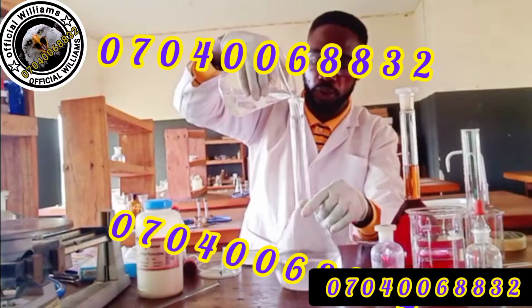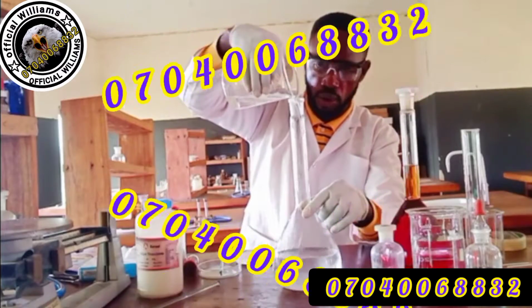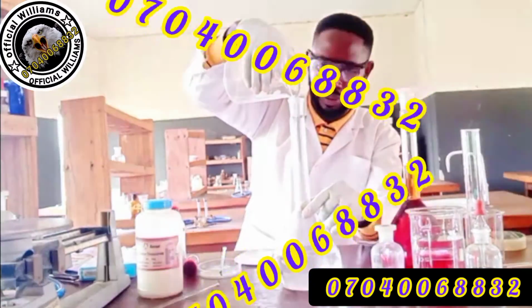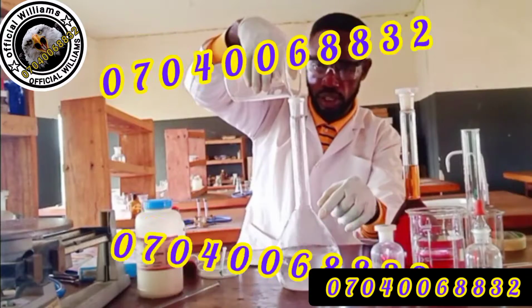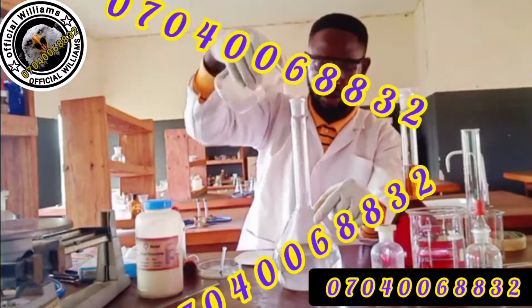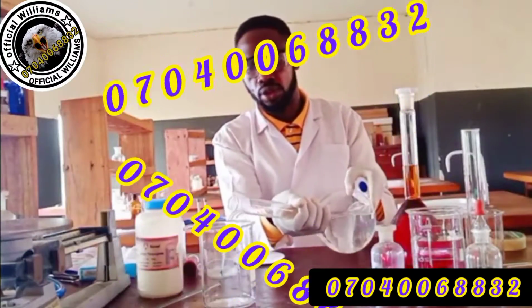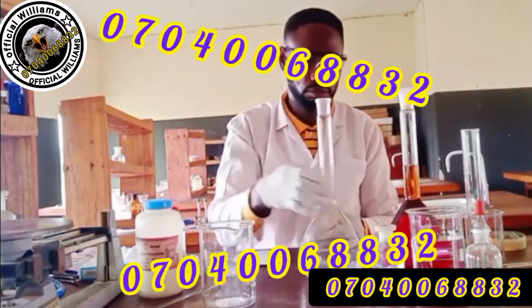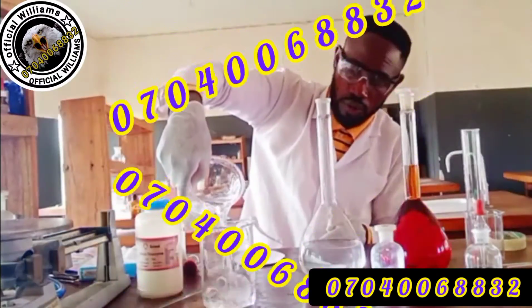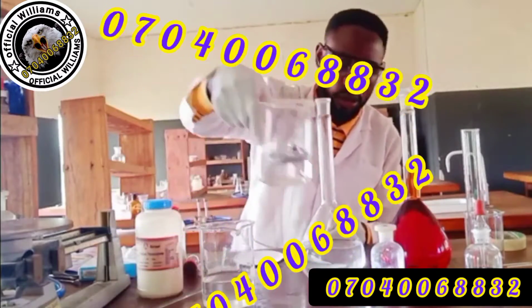Don't even allow a drop to fall off from this one you are pouring, because the whole mass is inside there. So a drop leaving this volumetric flask means error in concentration. Then you can also pour back to make sure everything is collected, or rather, let's use ordinary water. This is distilled water, of course, suitable.